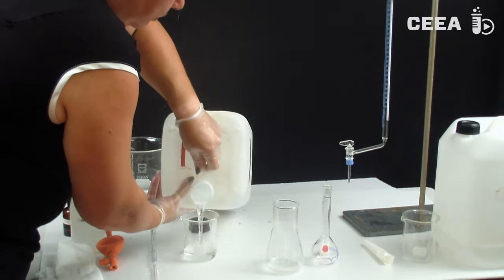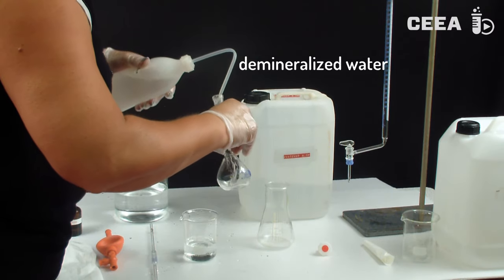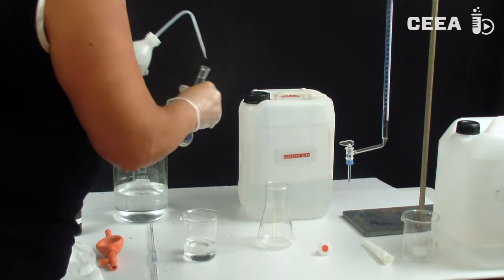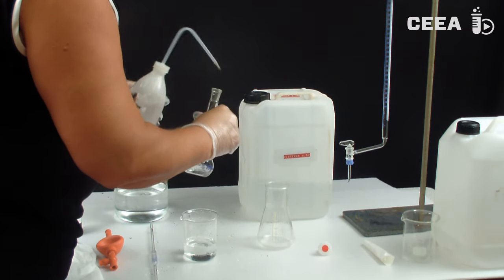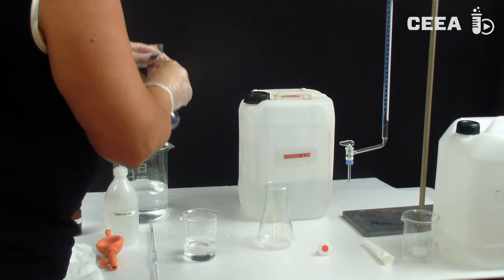Also, the volumetric flask has to be prepared by flushing. It's important to realize here that the volumetric flask will be used to add an accurate amount of solvent, so flushing should be conducted with demineralized water only.